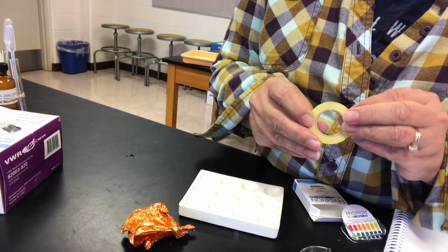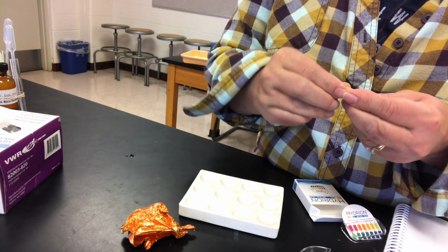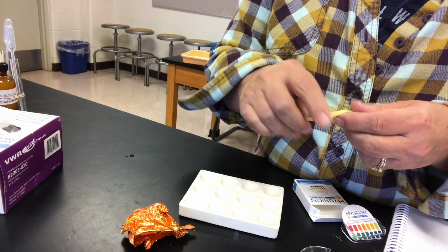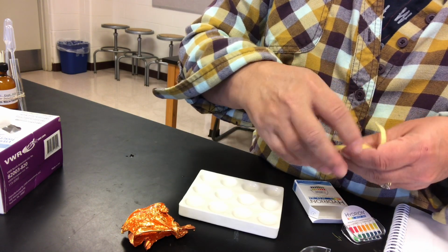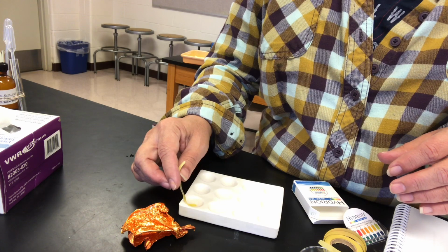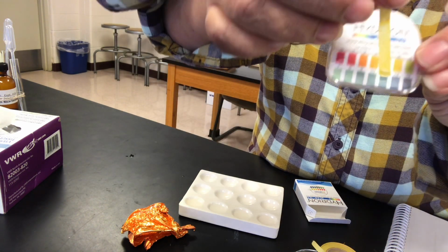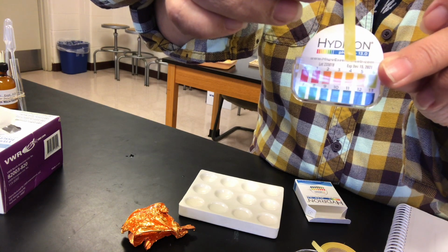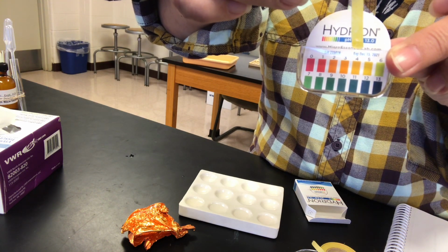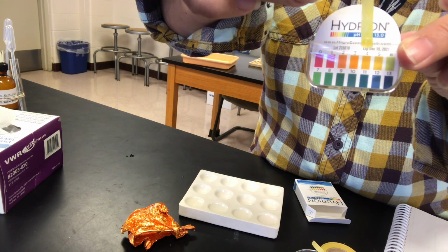I can't find where the, there it is. Here, let's do a refresh here. There's a nice piece. This is carbonic acid. It's kind of bubbling like soda pop, which is kind of interesting to see. And again, take a look at the paper and the chart. And do your best.